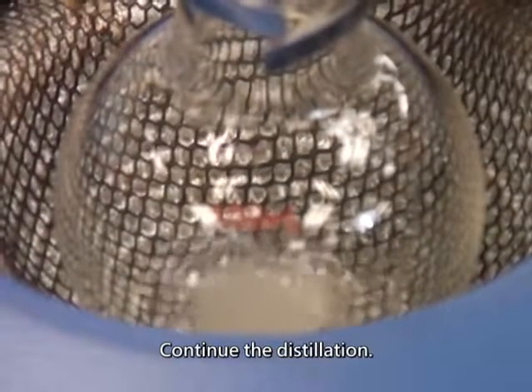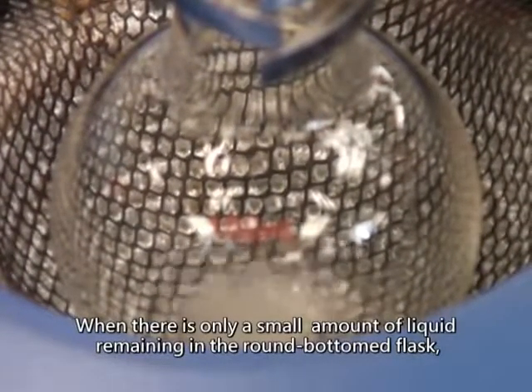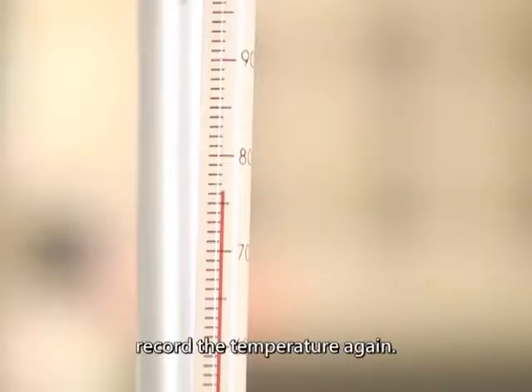Continue the distillation. When there is only a small amount of liquid remaining in the round bottom flask, record the temperature again.